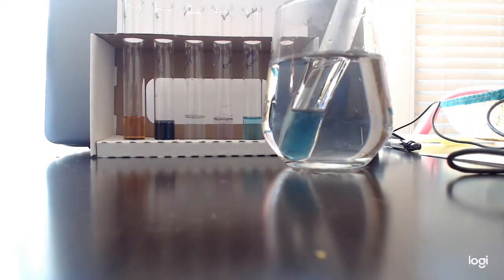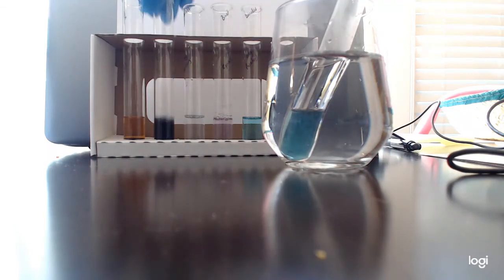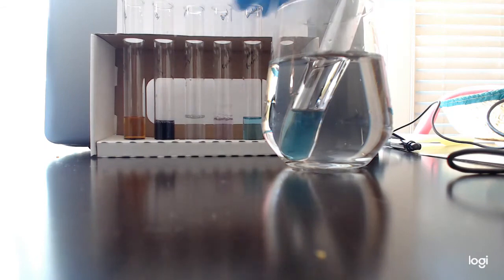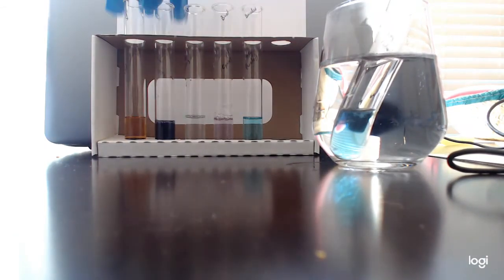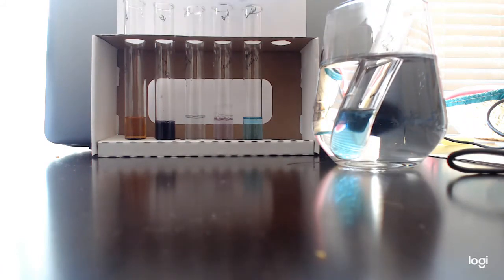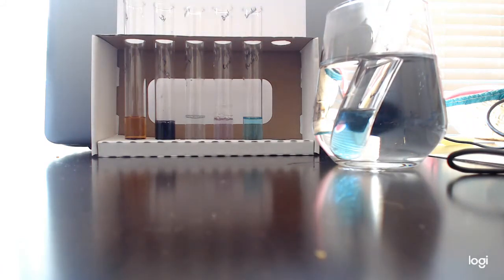So these are colorimetric positive and negative controls for the potassium iodide, negative and positive, Biuret, negative and positive, and Benedict, negative and hopefully positive tests. Potassium iodide test for starch, Biuret test for protein, Benedict tests for sugar. That's going to be our first video, and then the second video is going to be all of our food sources, and we're going to test them for all of these biological molecules.